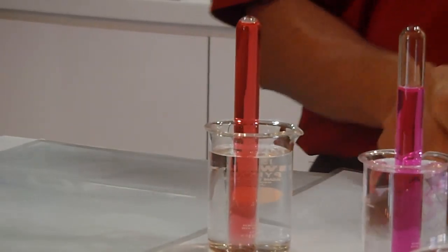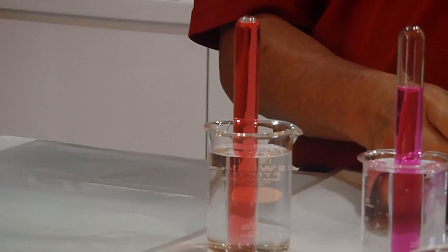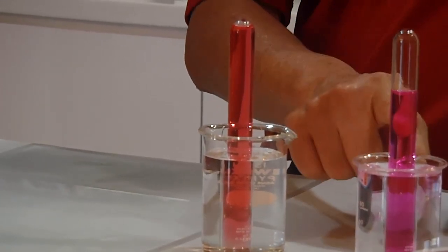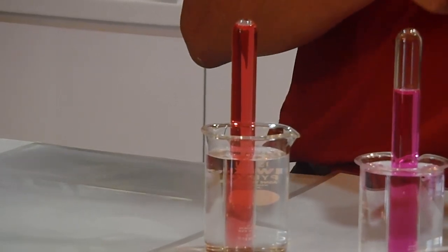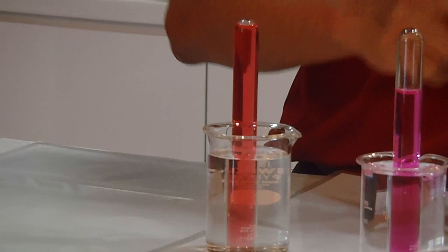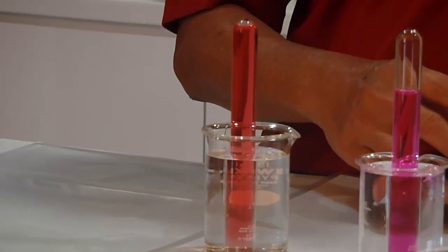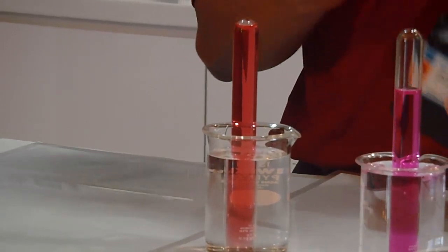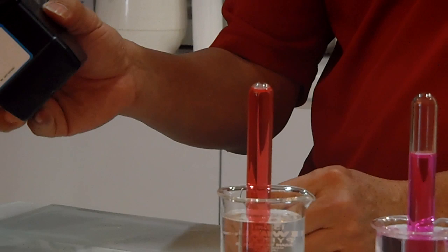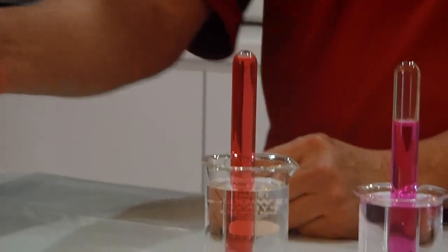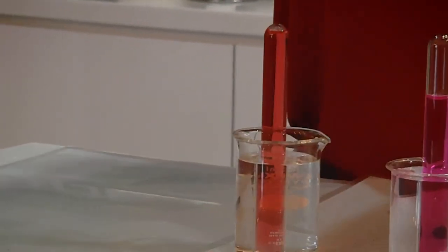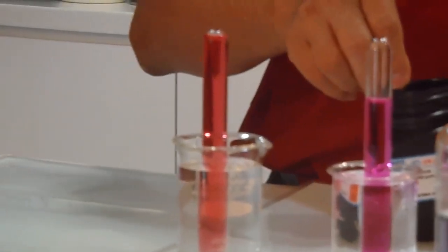The red will turn to what color? Remember this left, right test tube, colorless becomes pink. Then this one red becomes, let's see. Just put in one granule. You can photograph the calcium inside. Can you see the calcium inside? So I'm going to put another granule inside here. Now this is the calcium you cannot eat.